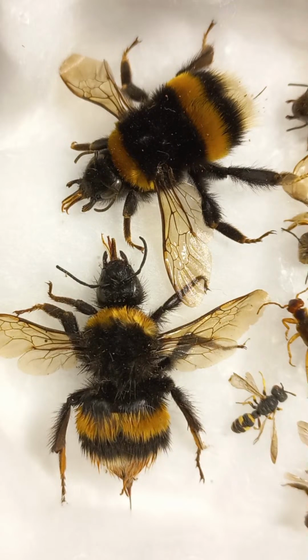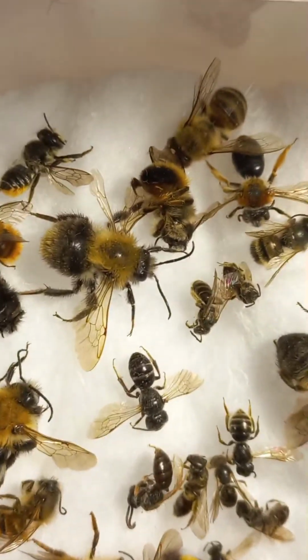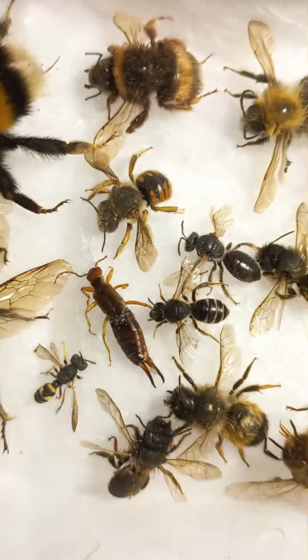Let's watch more solitary bees in the collection. Oh no, better to turn it.